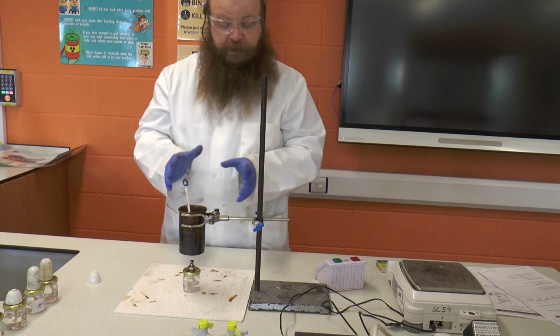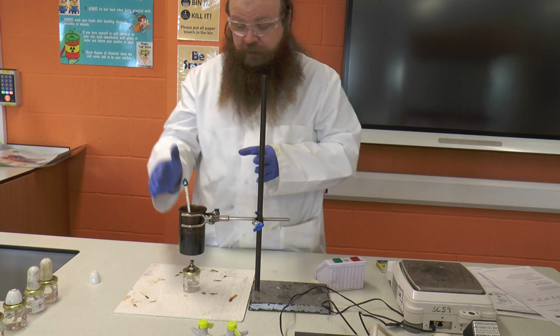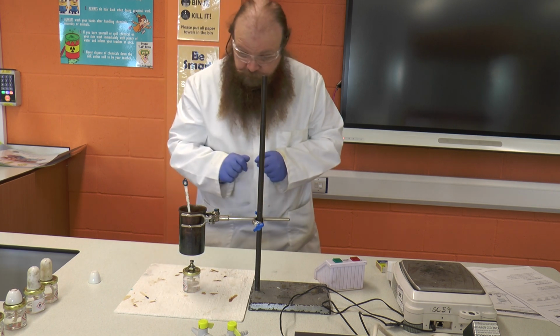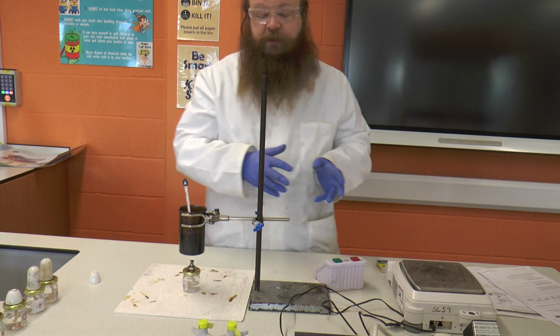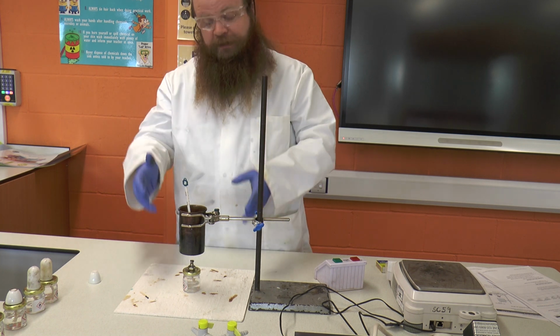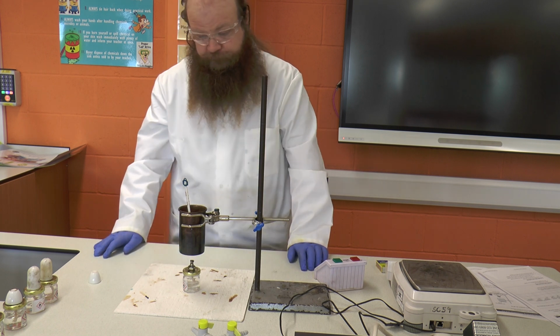So now we sadly have the boring bit while we wait for the 2 minutes. But it's important that you keep an eye on this and you make sure that you're getting a reasonable increase in temperature. The temperature's already gone up. It's now already at 36 degrees, and that's only after 40 seconds. So we're getting a nice, reasonable temperature change. So we know that the heat is being transferred from the burning alcohol into the can.